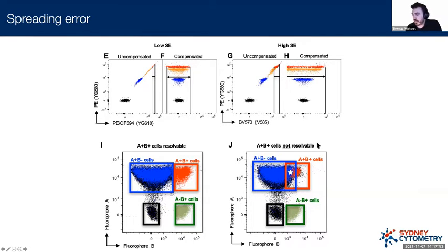However, if we look at this example on the right, this is slightly different. This is where we're seeing overlap. In this case, the single positive here in blue and the double positive here in red are actually overlapping. So we can't draw an accurate gate that will allow us to see the red cells separately from the blue cells. So if you imagine, let's say, fluorophore A is labeling a T cell marker, CD3, maybe B is labeling some kind of activation marker.